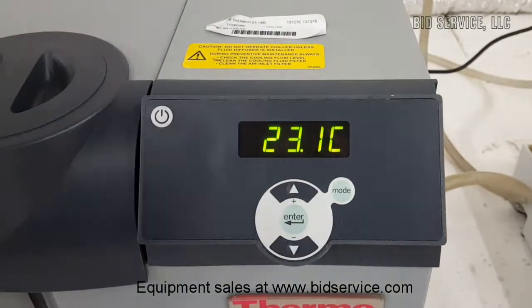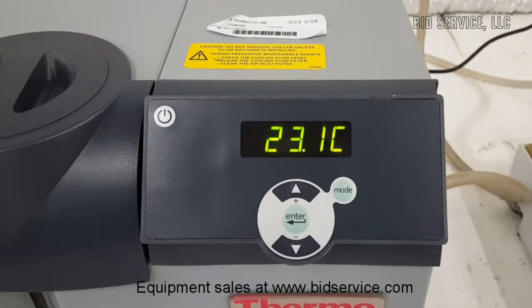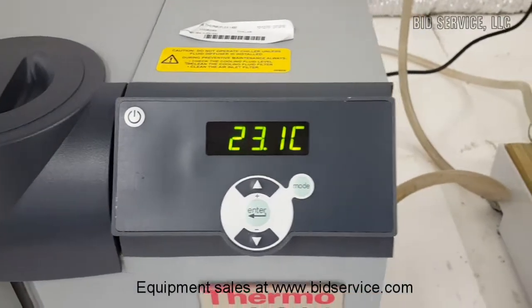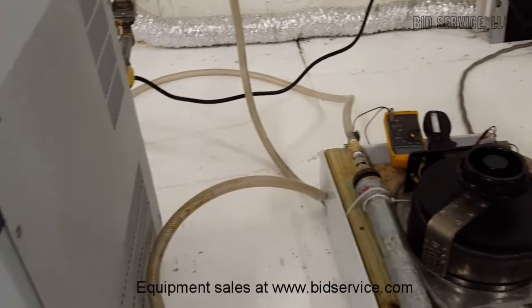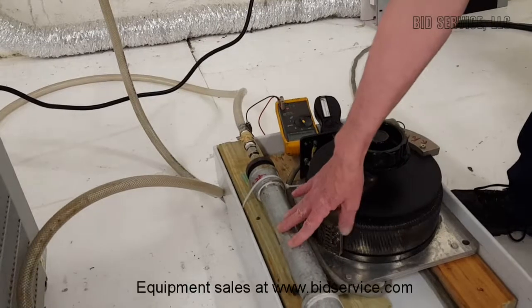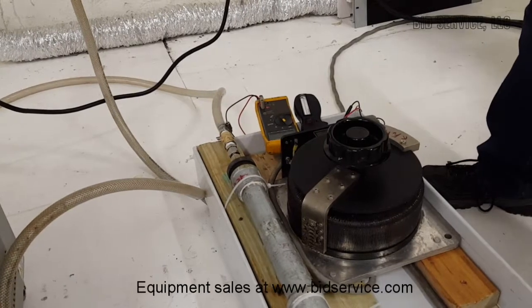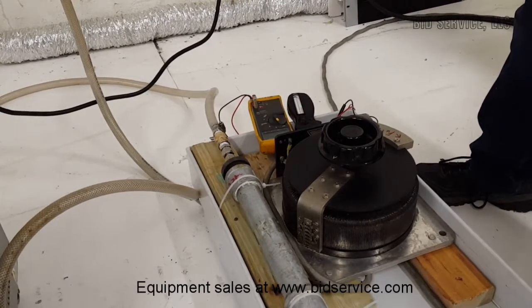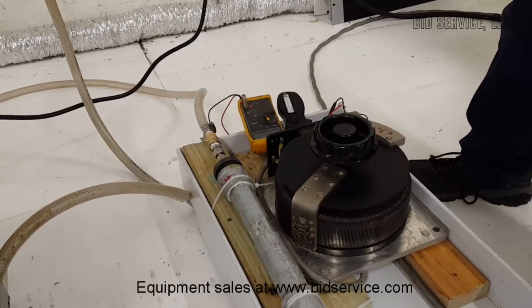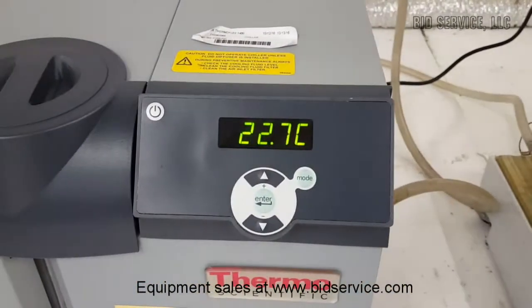We're going to let this cool down for a few minutes until it reaches 20 degrees C. Then I'm going to turn on an active load on the water — a 1,400-watt immersible heater. The specification is that it has to be able to hold 20 degrees C at 1,400 watts for a total of one hour. We'll come back in a few minutes and see how we're doing.